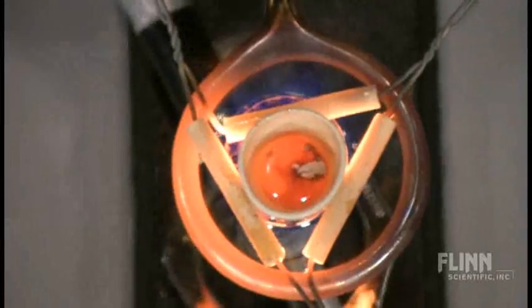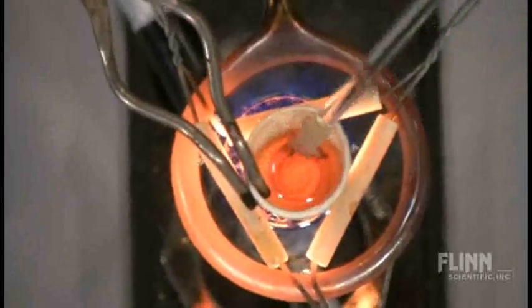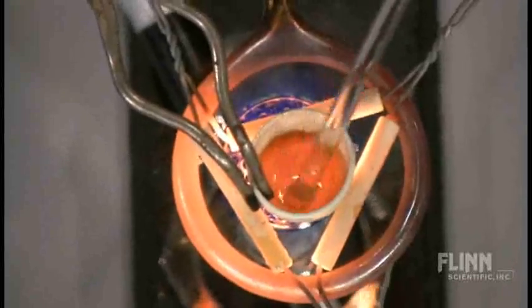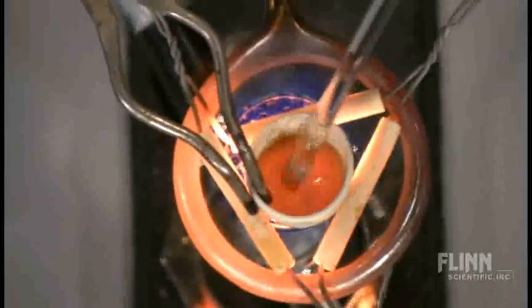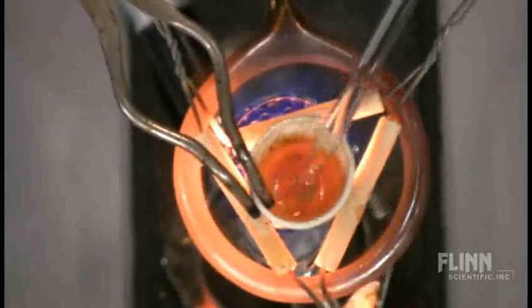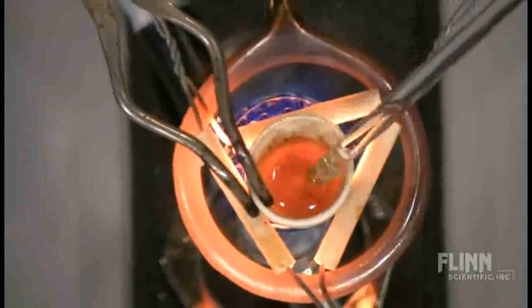And now this is where you need the crucible tongs, because I want to make sure this gets mixed in with my glass. Now you really can't tell from looking at it at this point that it's done anything to the glass, because it's red hot, so we have no idea at this point what the color is going to be, and neither will your students.